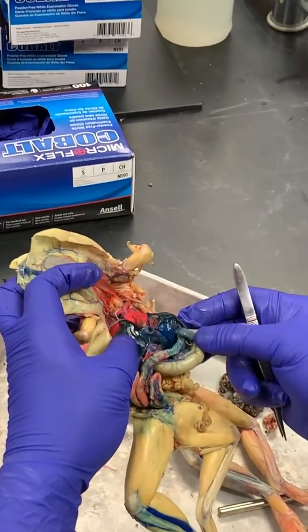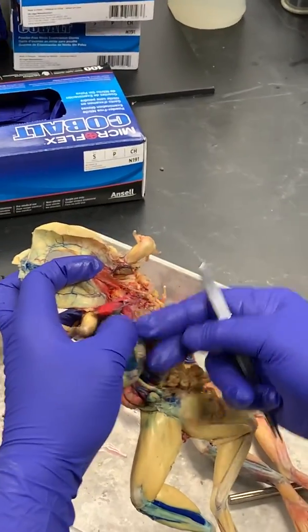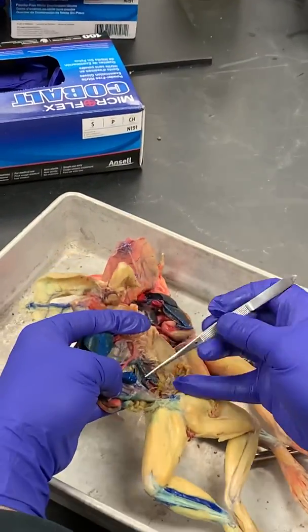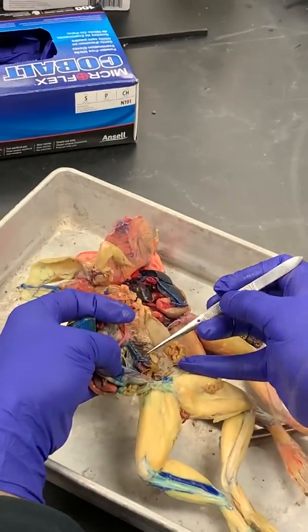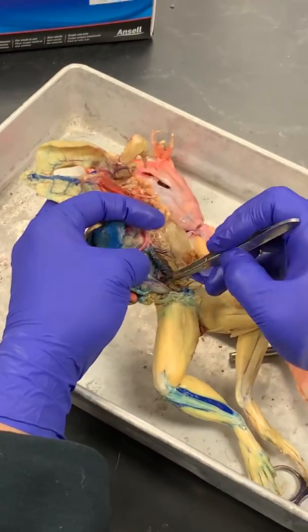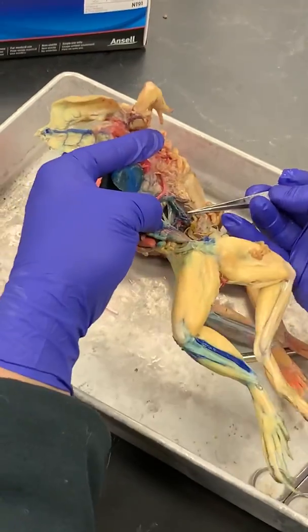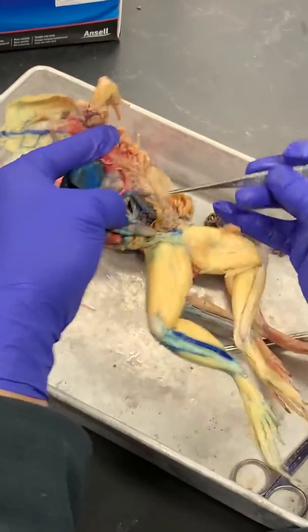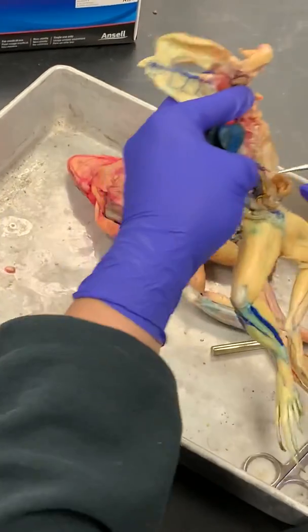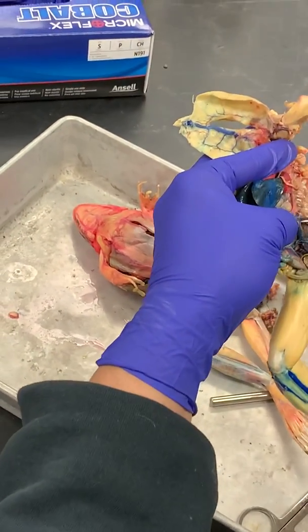The next way is I'm going to peel all the organs off to the side, but this time I'm going to look at the tops of the kidneys. So I'm not lifting up the kidneys off the dorsal body wall. I'm just going to look at the kidneys head on. Here's a kidney, and here's the other kidney. You can see this big blue vein in the middle. That's the post cava or posterior vena cava.